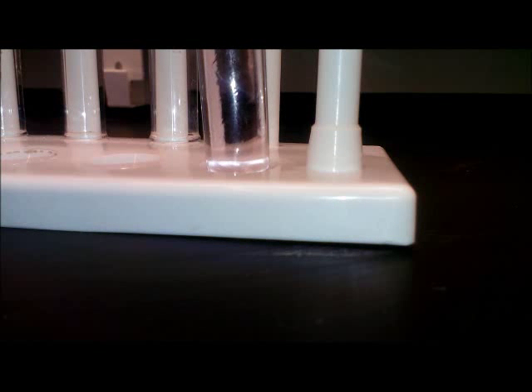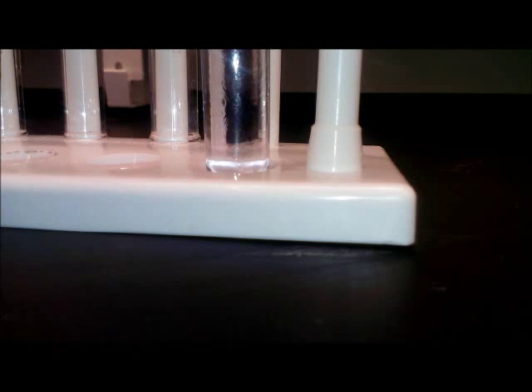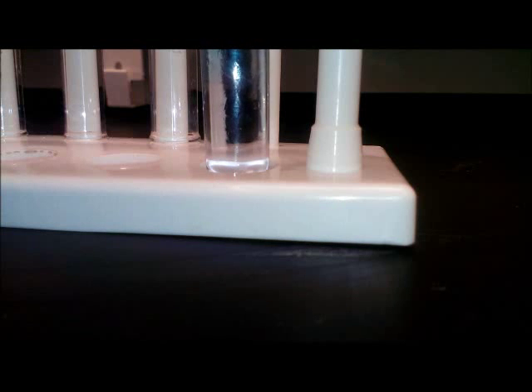With an excess of chloride ions, the reaction shifts to favor formation of a negatively charged cobalt chloride complex. This complex has a blue color, which you will slowly begin to see as more acid is added.